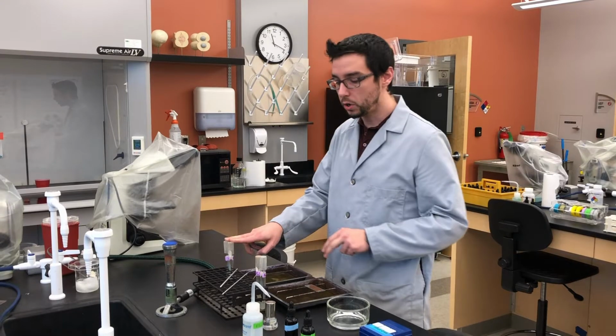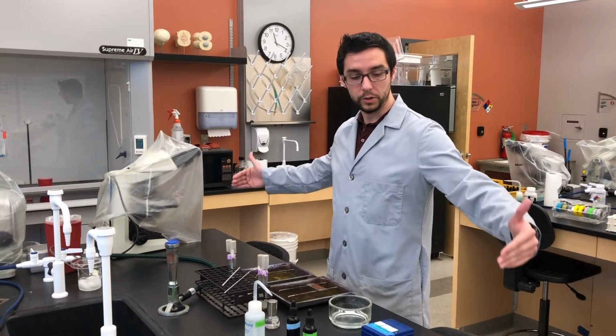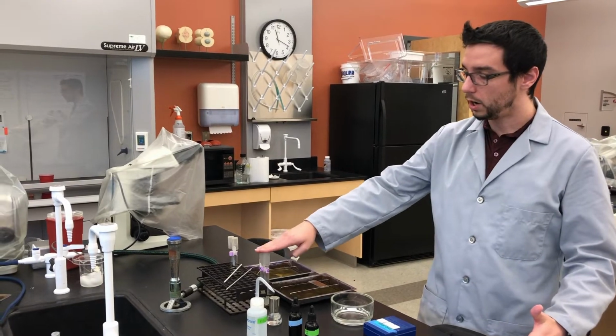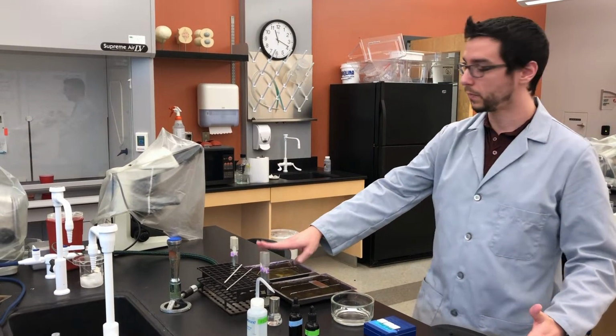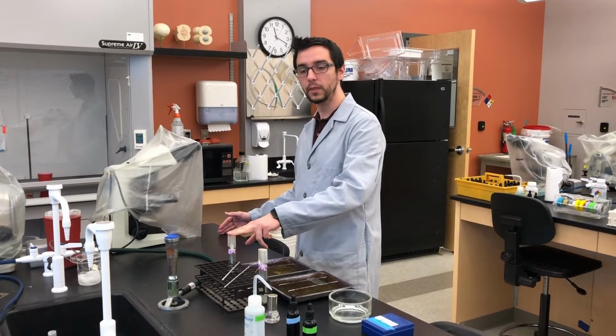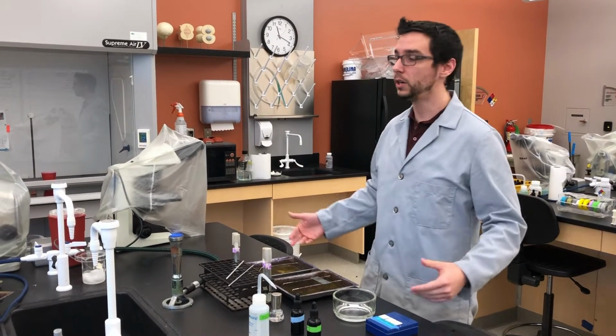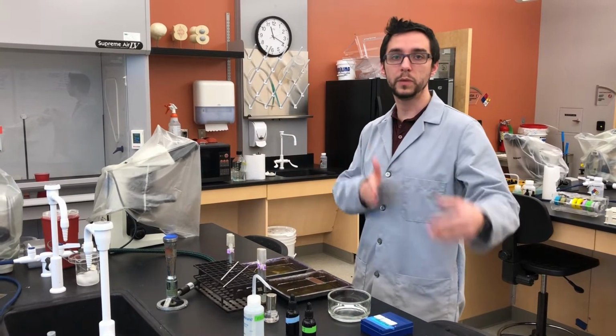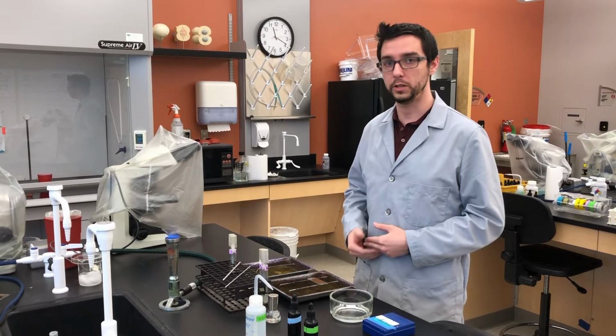Okay? So what you're going to be doing is working together with your lab partner. One lab partner will be performing the stains on the 1-day cultures, and the other lab partner will be performing the stains on the 4-day cultures. And then you're going to want to work together when you're visualizing your stains at the end to determine which bacterial species is the endospore forming species.